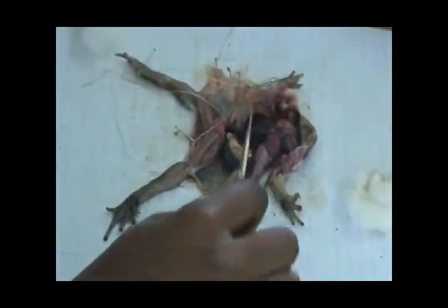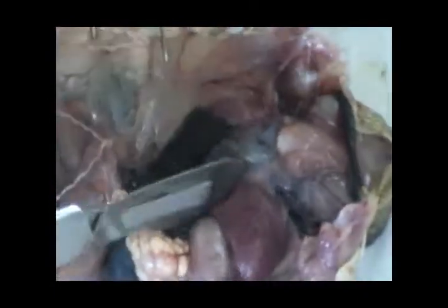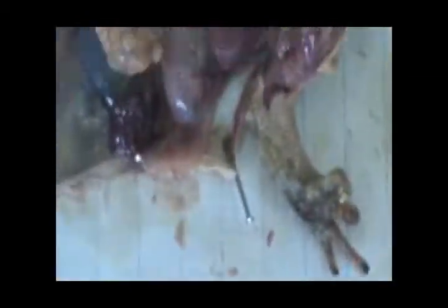Now we have to displace our heart in order to see the blood vessels. Before we displace the heart, when it's in its normal position, we are seeing this big middle structure here — a main blood vessel inside. This is called the truncus arteriosus, this big blood vessel here in the middle.